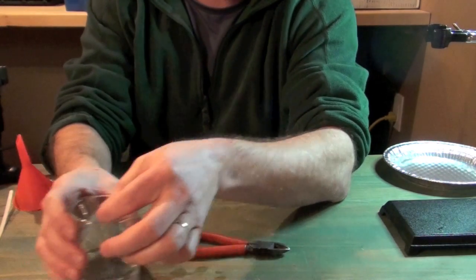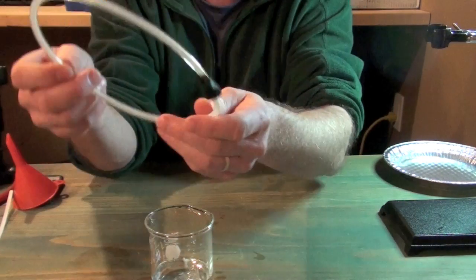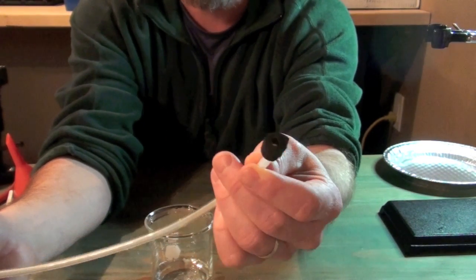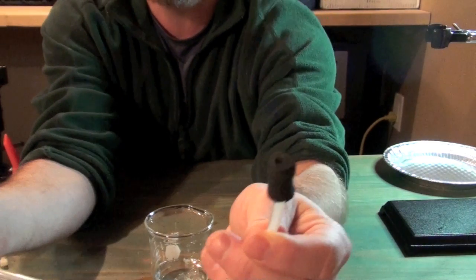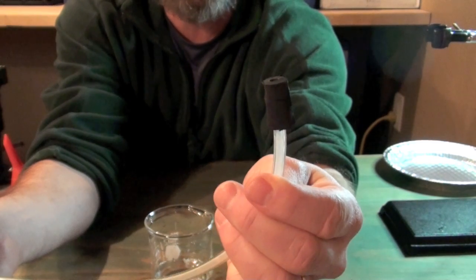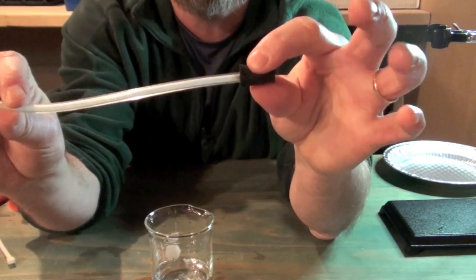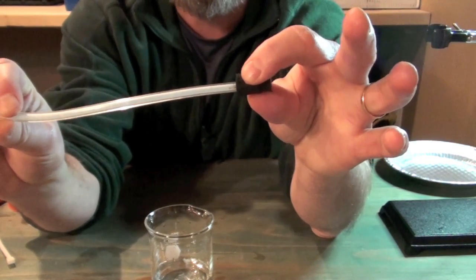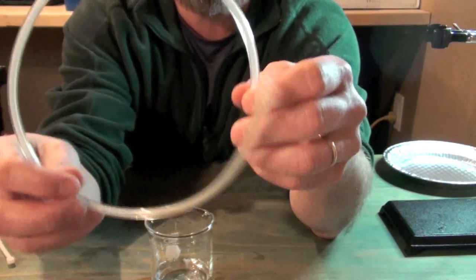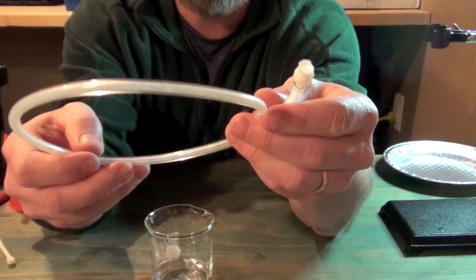So I'm just going to take this dialysis tubing and let it soak for a bit. And what we're going to do is take a look at a very simple apparatus. What I've got here is a small gauge rubber stopper, and that rubber stopper is going to be the same gauge that's going to just roughly fit into the dialysis tubing end. And then it's a single hole rubber stopper, and into the rubber stopper I've got some plastic hose, and this is basically the same type of hose as what would be fish airline tubing. This hose actually comes with an electronic pressure sensor. I'll get to that in a minute.